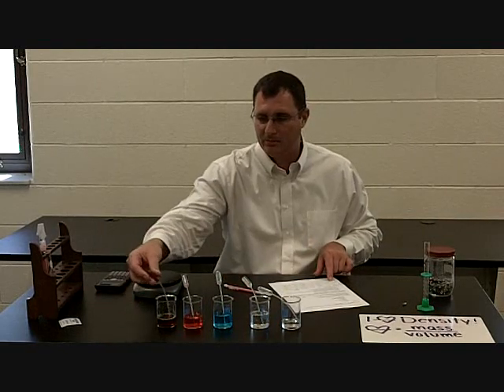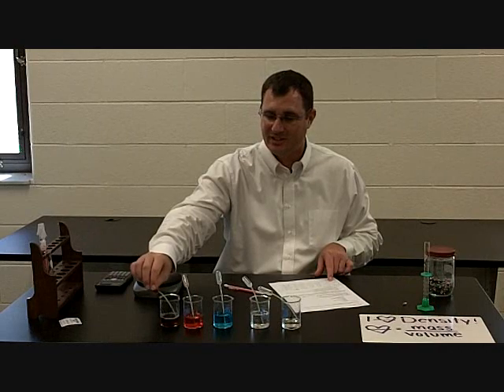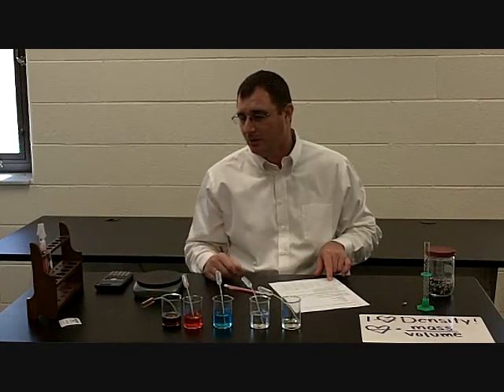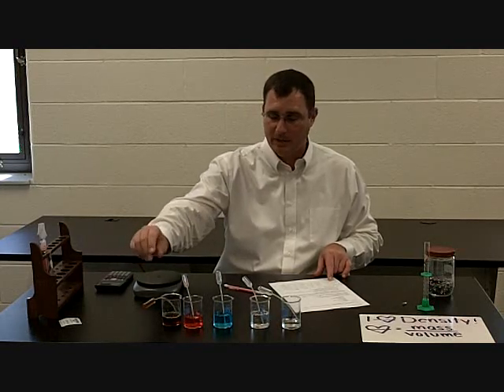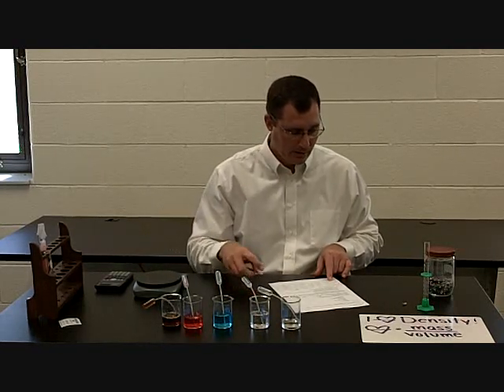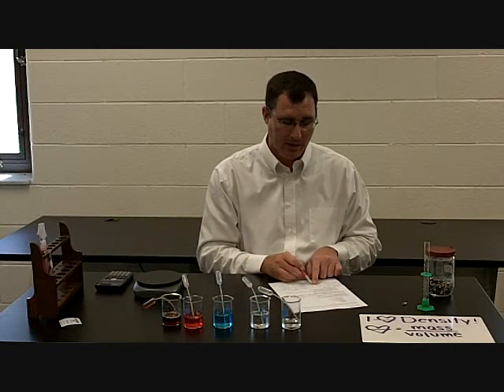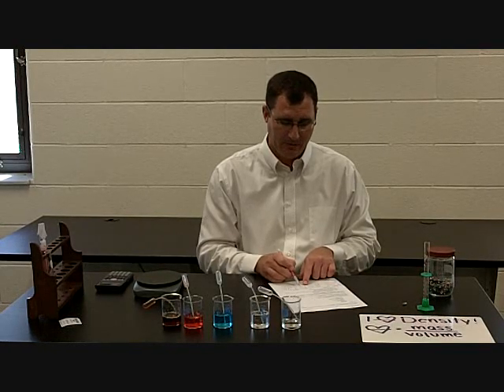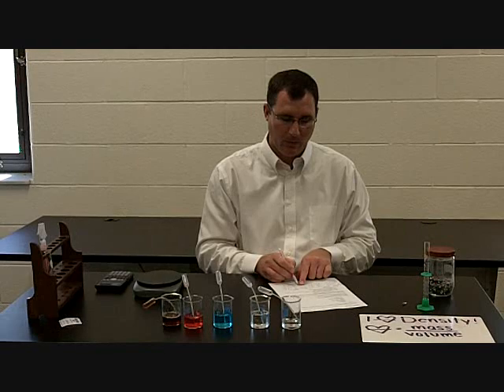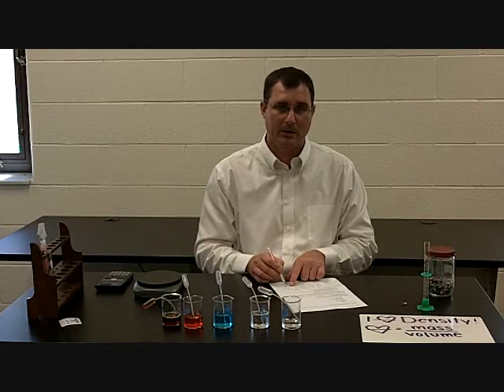The last one is maple syrup. It is hard to get up into the pipette — it's very viscous, a thick fluid. It takes about 4 or 5 minutes to get the pipette full. The syrup weighs 7.0 grams. I subtract 0.9 grams for the pipette, giving me 6.1 grams. I divide by 4.8 milliliters and that gives me 1.3 grams per milliliter.